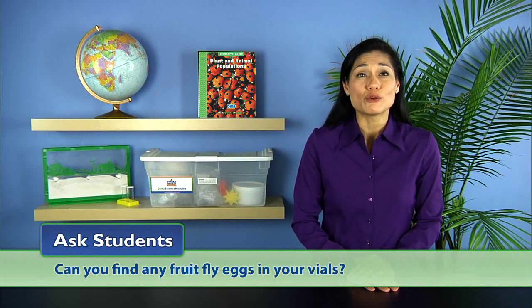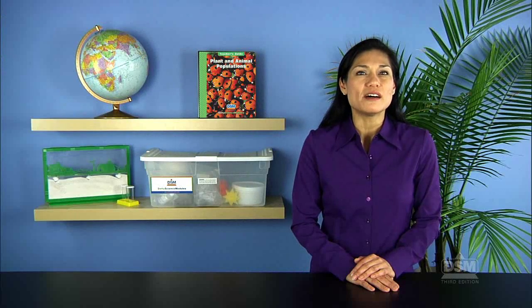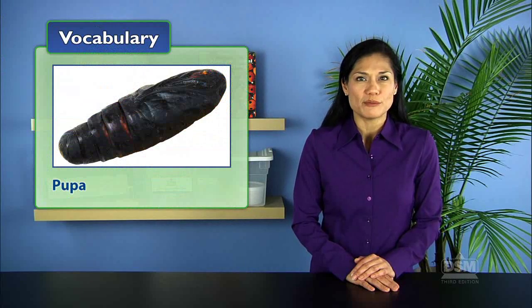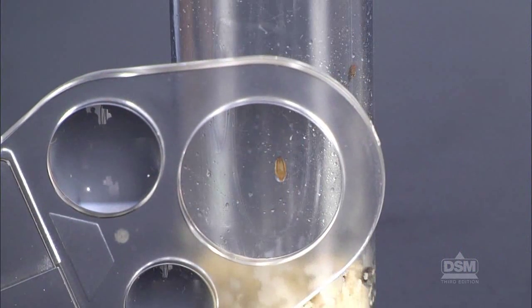Next, explain that a fruit fly larva hatches from an egg and ask, can you find any fruit fly eggs in your vials? The eggs are difficult to see because they are laid in the medium. They look like tiny dots attached to the sides of the vials. Then inform students that before a larva becomes an adult, it turns into a pupa. A pupa has a hard shell and does not move. Ask students, can you find any pupa in your vial? They may see that the hard cases of the pupa are yellowish in color.